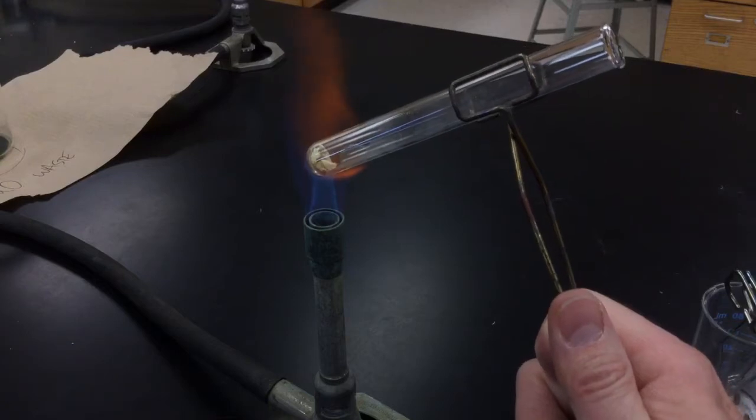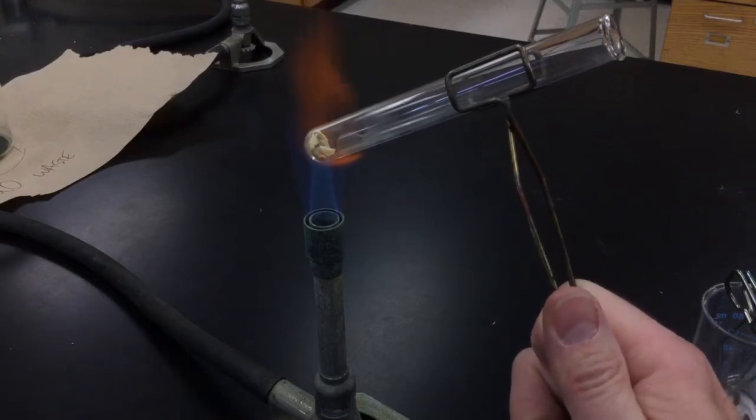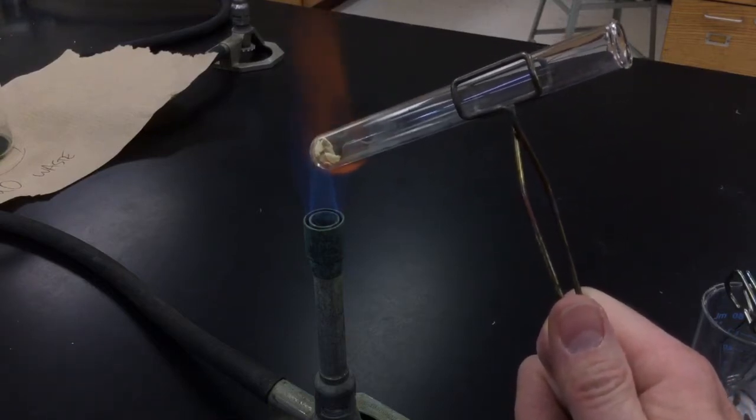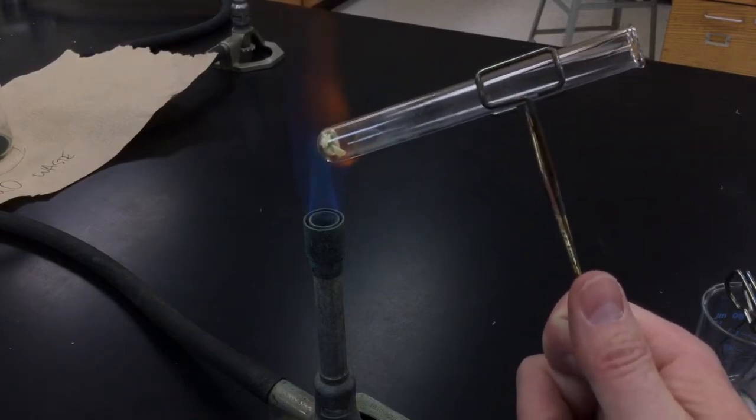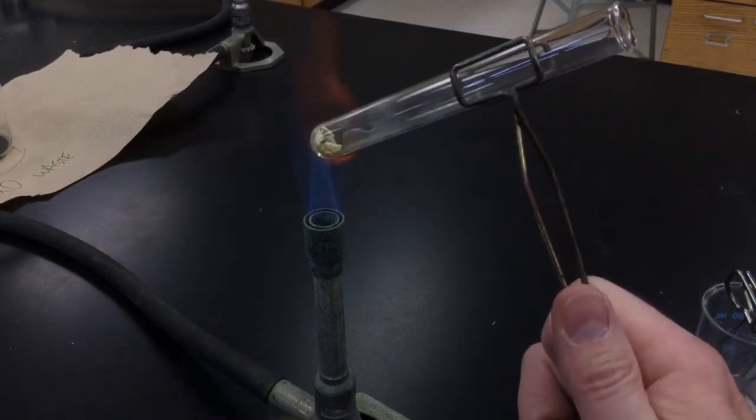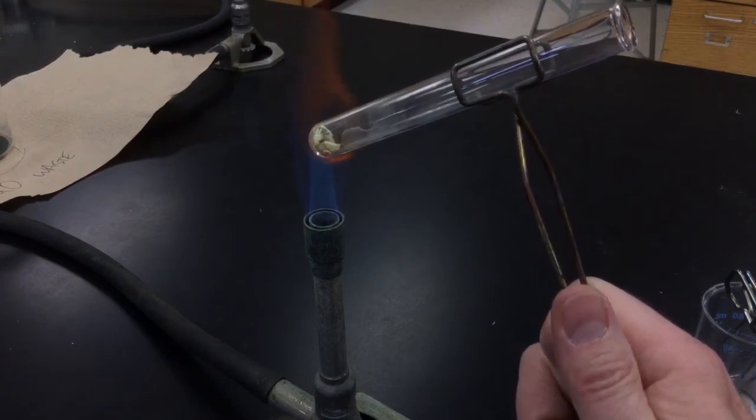Okay, so I think that's about it. So what I'm going to do now is let my test tube cool down, and I'm going to get the final mass of my test tube plus my product. What we have left over is just our copper sulfate without the water molecules attached to it.